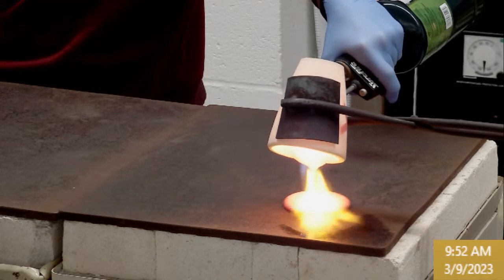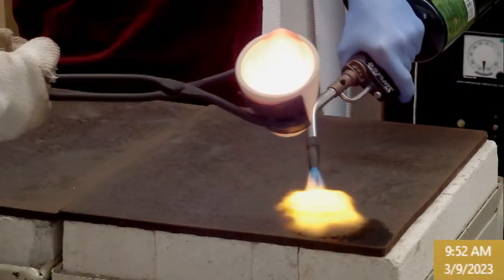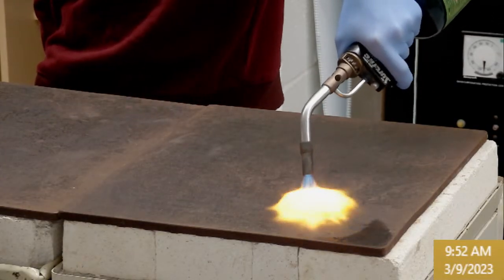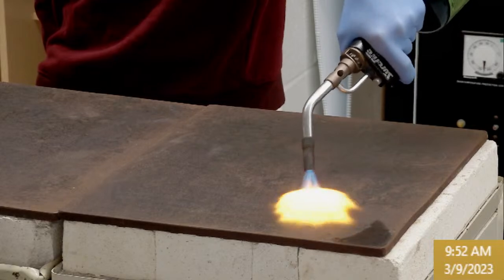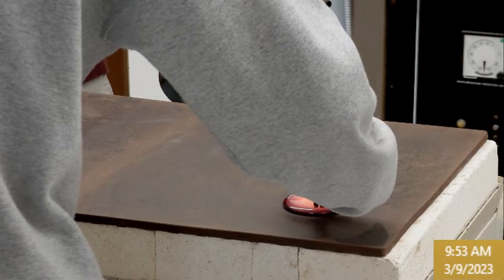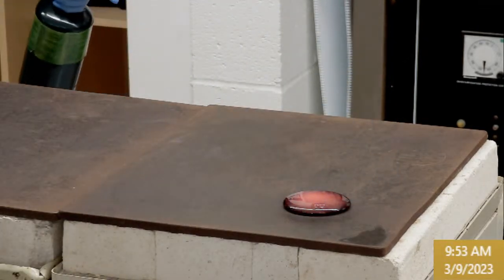Kinda, yeah. All right, so now you can hit that top part, keep going, and try to get that to pull in flat. Keep going. Right about there is good. And so then just kind of gently press in. Yep, perfect, that's good. So I can already see some interesting green color on the strand.